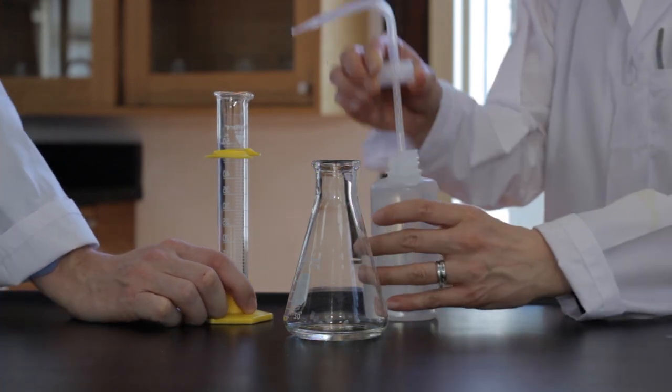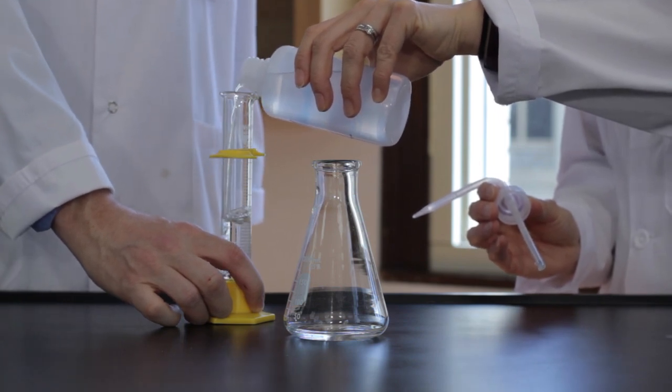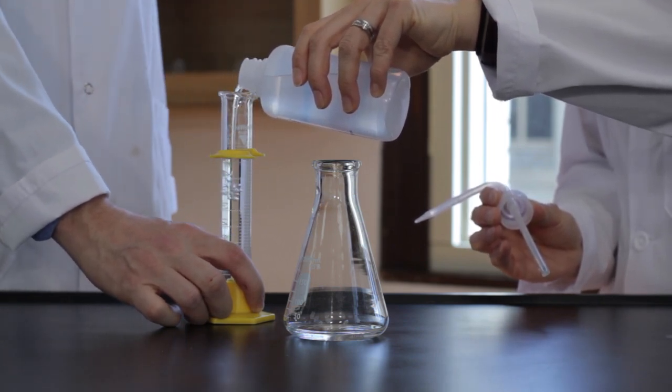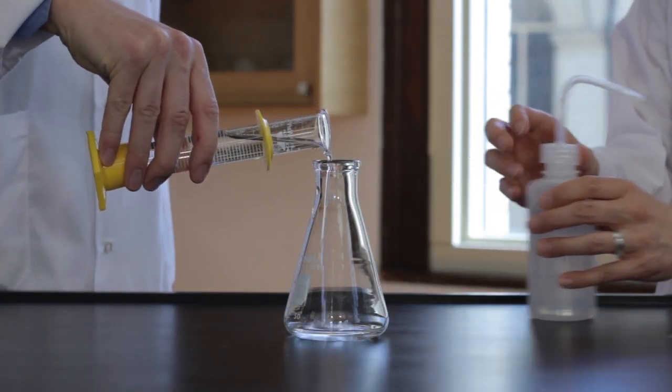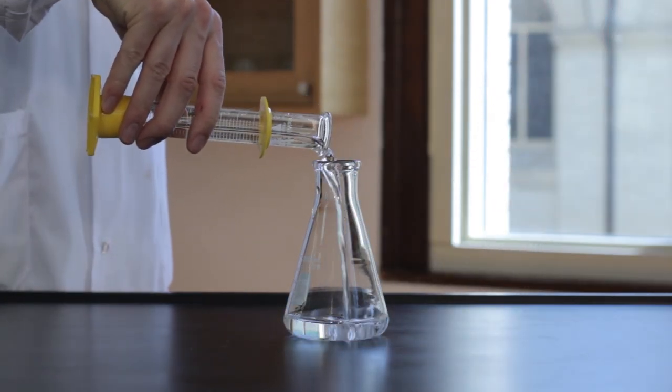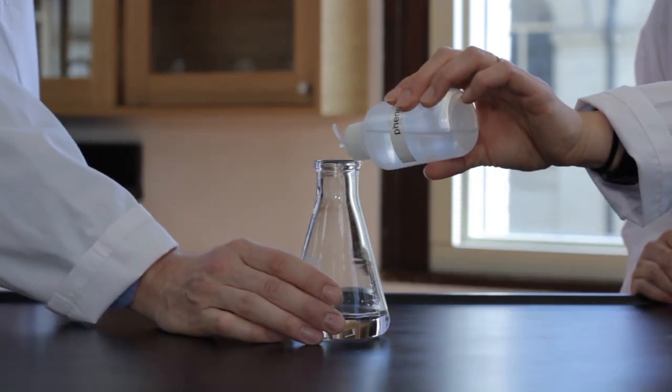Add 50 milliliters of distilled water and 5 to 8 drops of phenolphthalein.